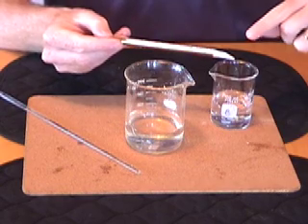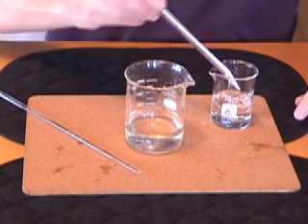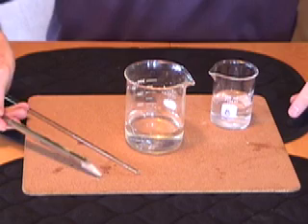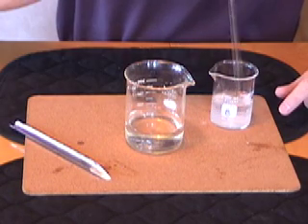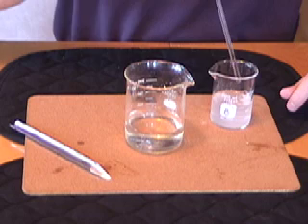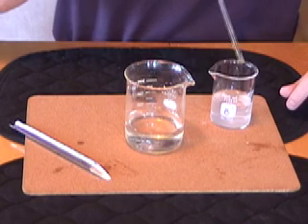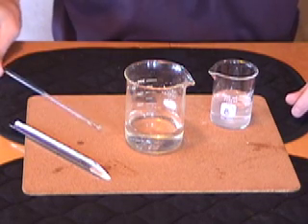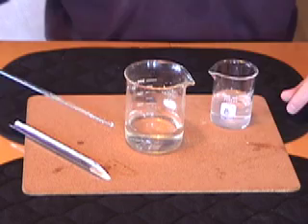Here I've got some sodium hydrogen carbonate on the spatula. I put it into solution and we'll stir it around a bit, and I'm about to place this sodium hydrogen carbonate aqueous into a 5% solution of acetic acid, which is CH3COOH.